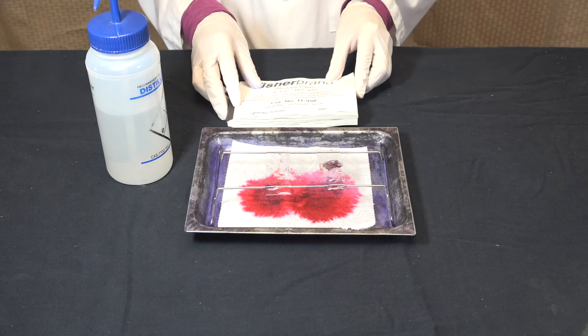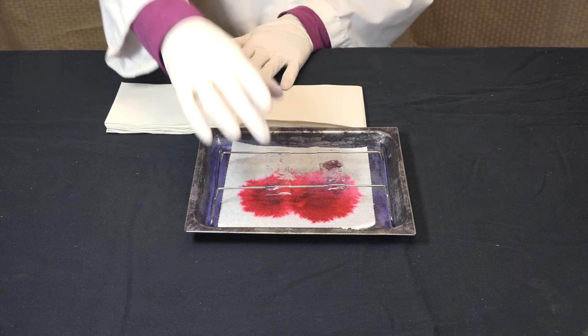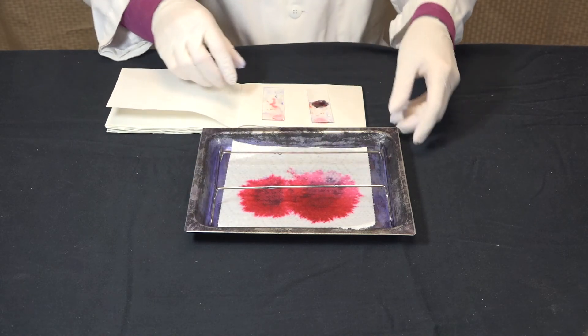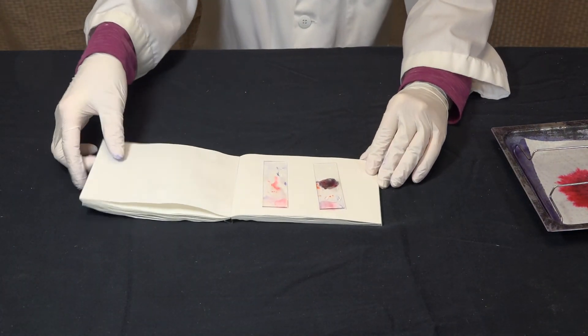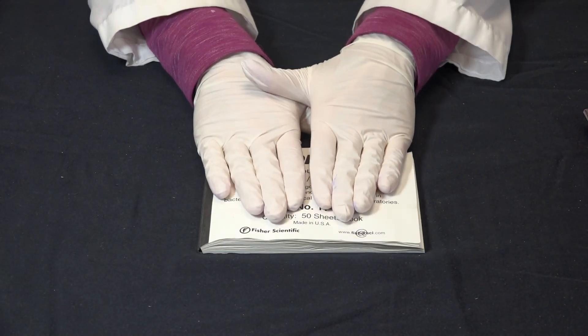The final step is to blot the slides dry with bibulous paper. Just place the slides on the paper. Close the pad and press down lightly so you don't break the slides.